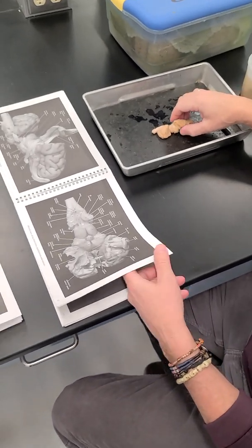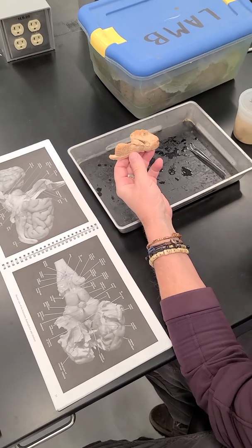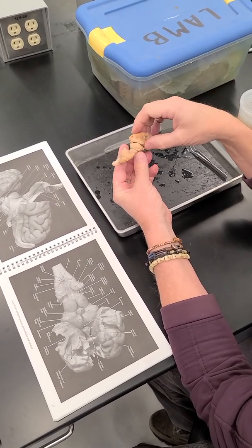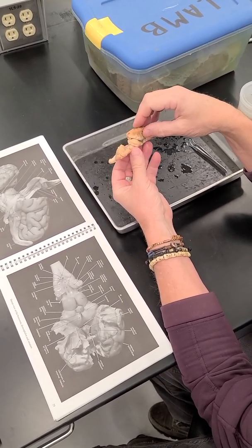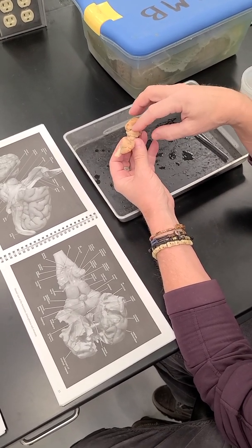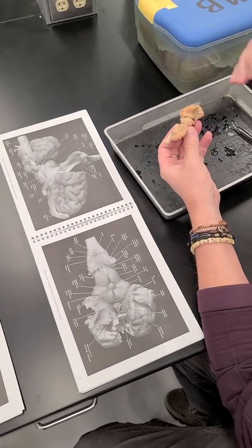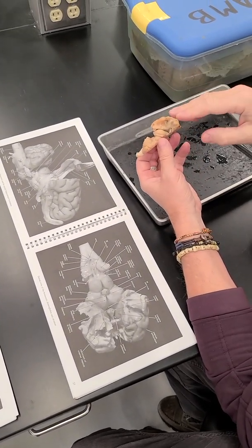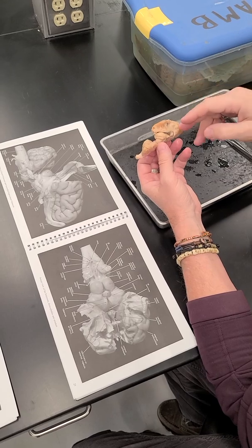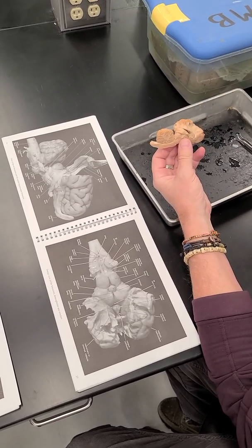much of the parietal and all of the occipital lobe, so that you can see some of the structures that are deep to those lobes. And primarily I wanted to show the hippocampus, which is illustrated here, kind of peeled away, and also its relationship to the lateral ventricle and to the basal nuclei and to the thalamus underneath it.